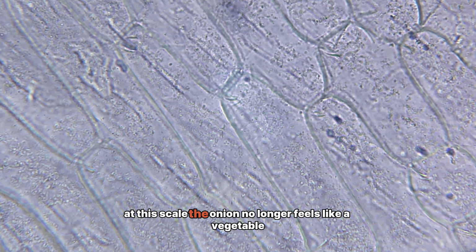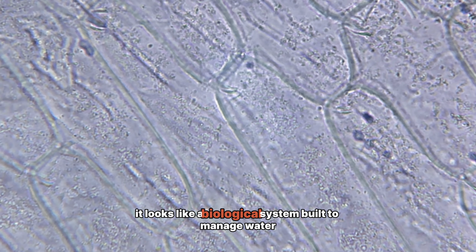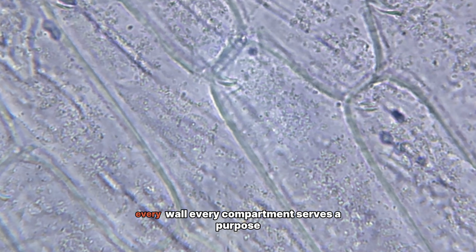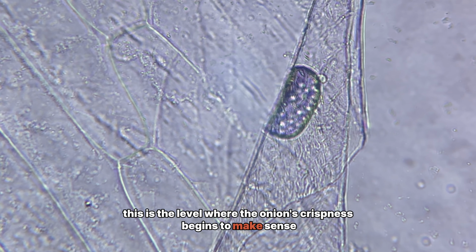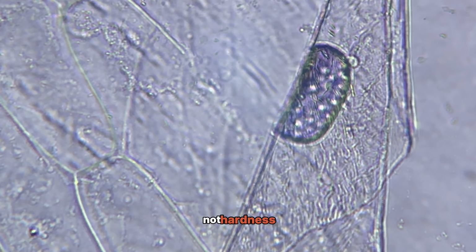At this scale, the onion no longer feels like a vegetable. It looks like a biological system built to manage water, pressure, and stability. Every wall, every compartment serves a purpose. This is the level where the onion's crispness begins to make sense. The resistance comes from structure, not hardness.